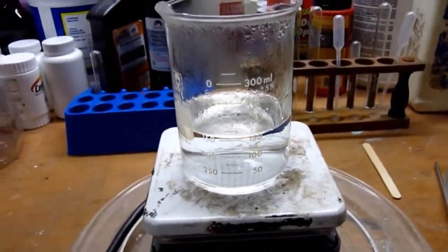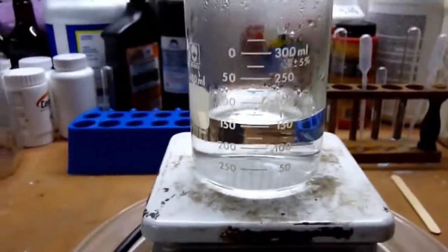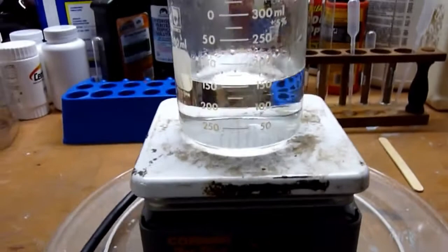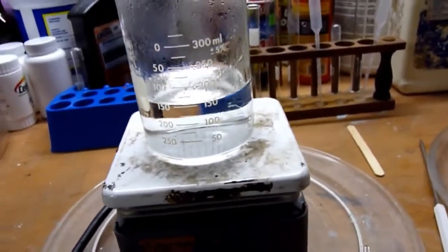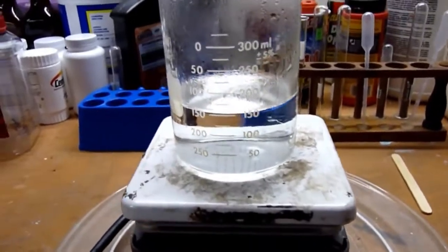And this would be a lot more dangerous than hot water because it's a hot, well, not right now, but it's a hot concentrated oxidizer. And it's hotter than the boiling point of water because it's got hydrogen peroxide in it.